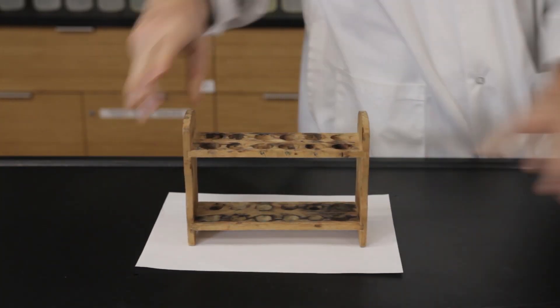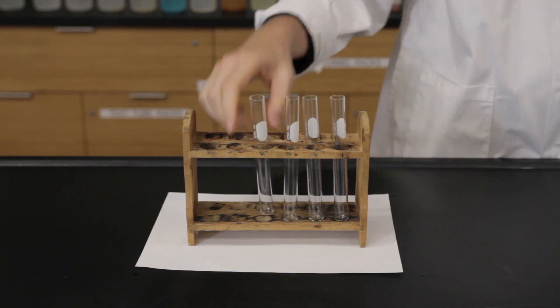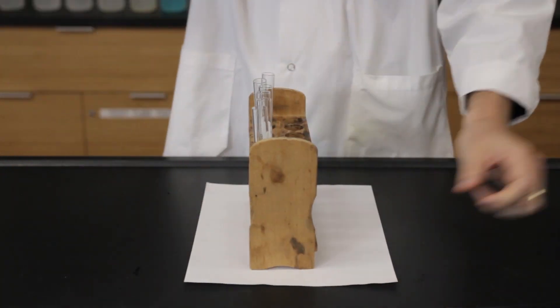Place your test tube rack on a piece of paper, insert all your test tubes, and label them on the piece of paper.